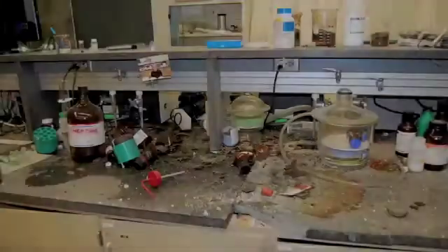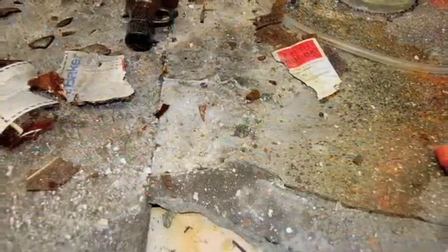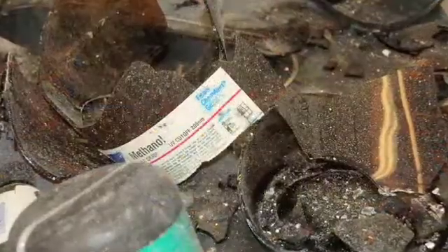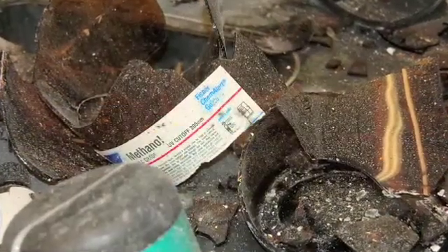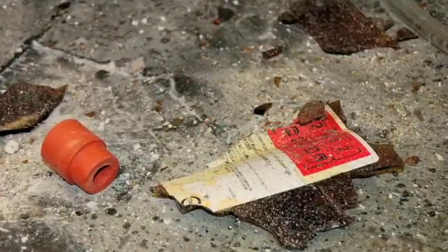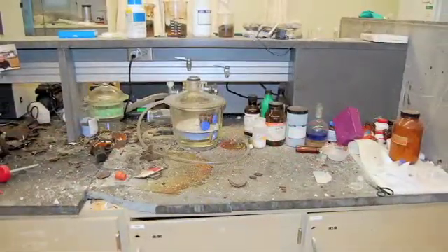Accidents in research laboratories are not isolated events. Since 2001, the CSB has gathered preliminary information on 120 explosions, fires, and chemical releases at university laboratories and other research facilities around the country. The accidents have caused deaths, serious injuries, and extensive property damage.